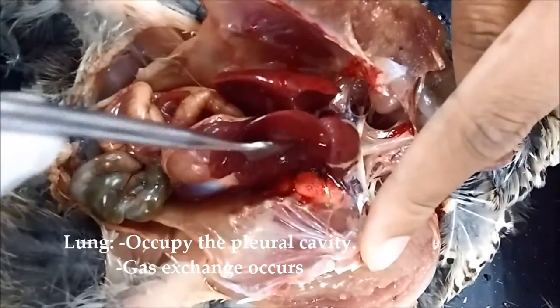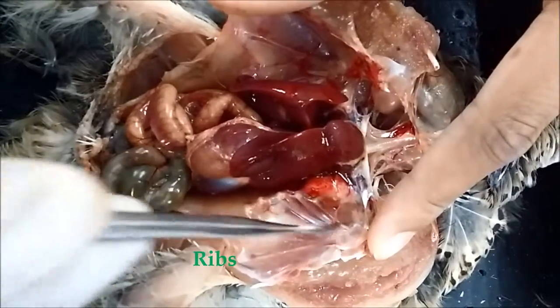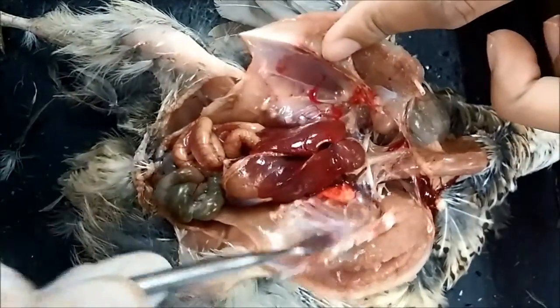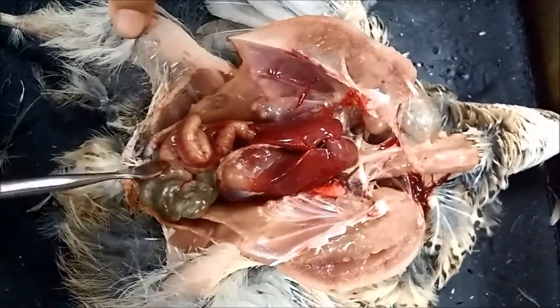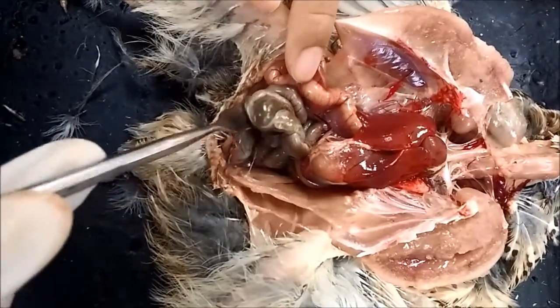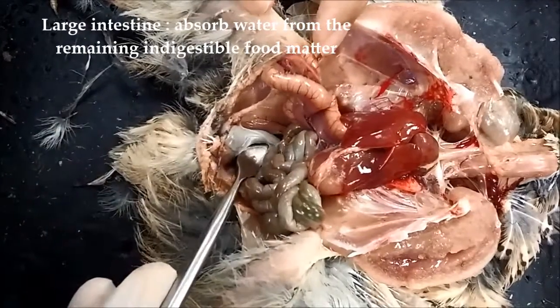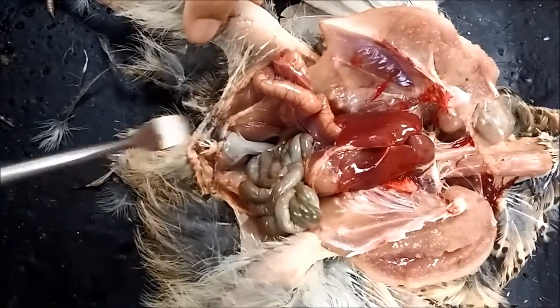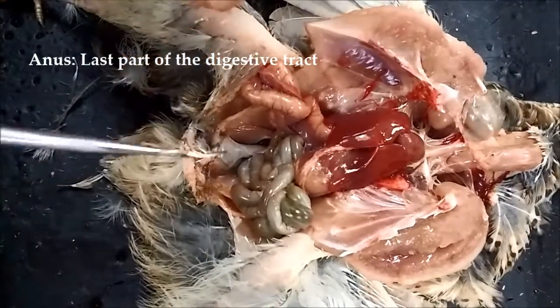The bright red, here, this is the lung. And this is the rib of the bird. Here, red. Also on both sides, here and here. Okay, next. Here, this is the large intestine, and it's actually connected to the cloaca of the bird, and after the cloaca, we will see the anus here, which is the excretory part of the bird.